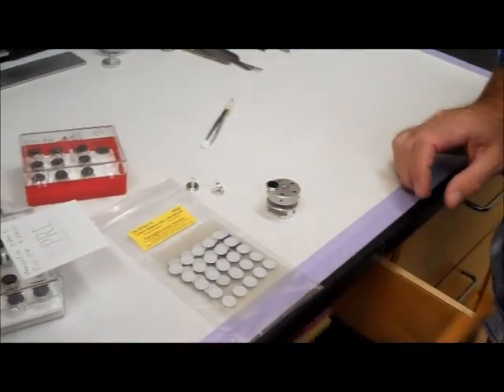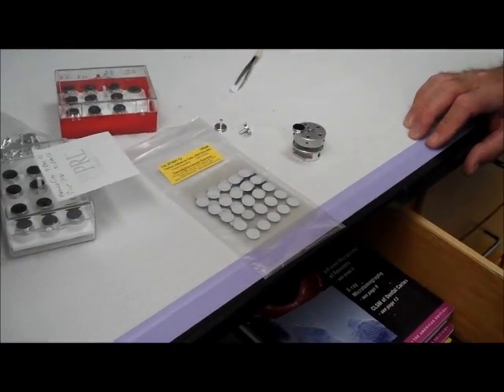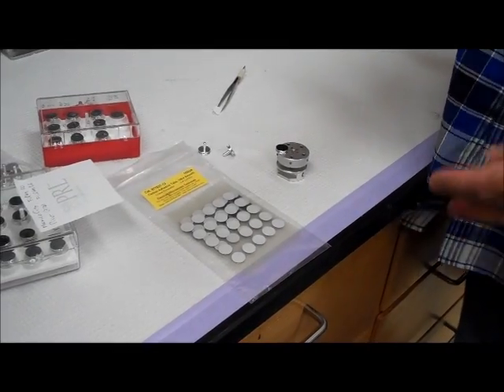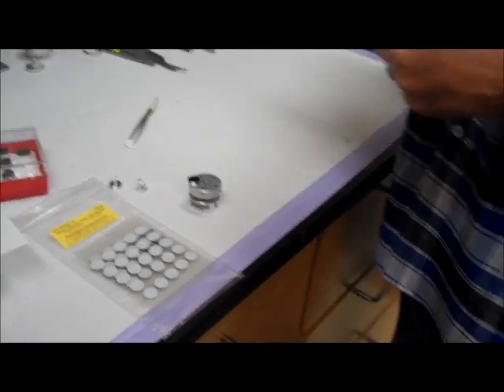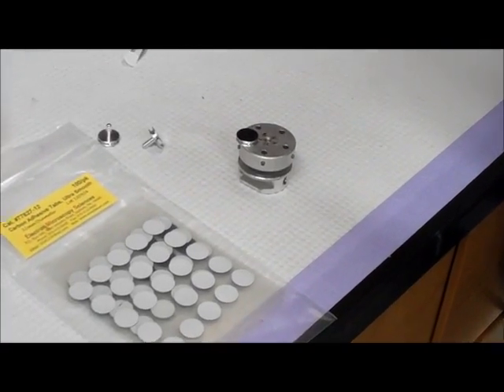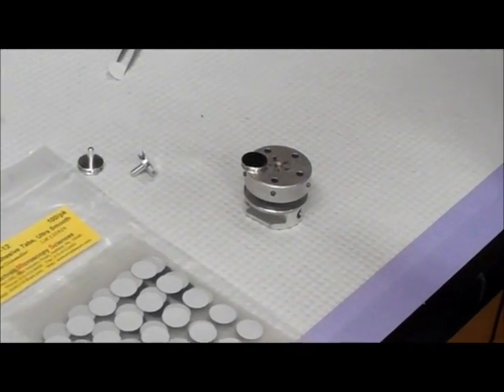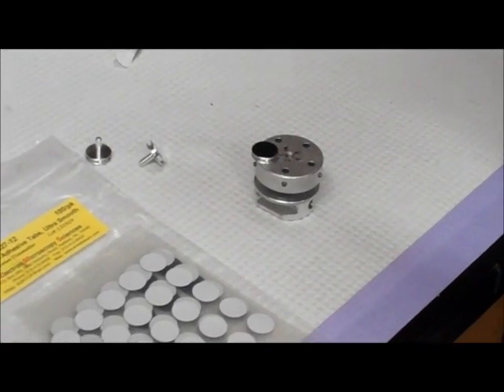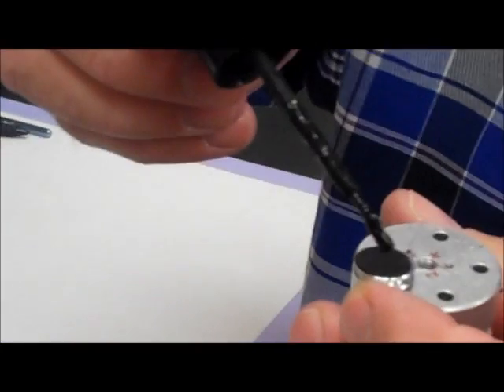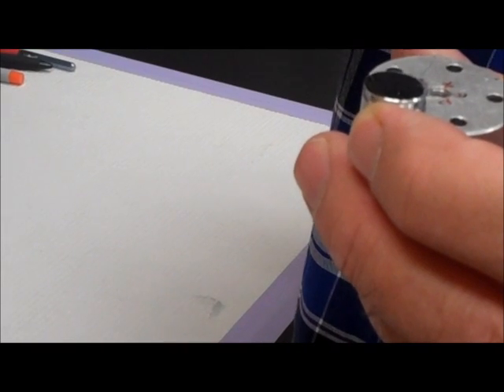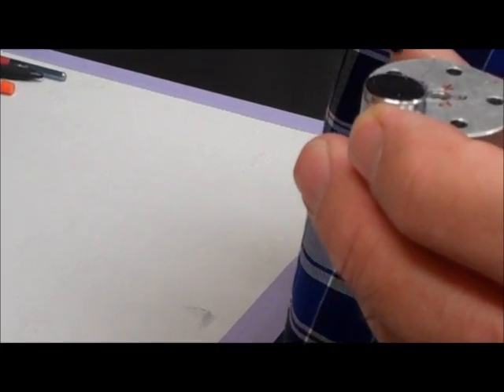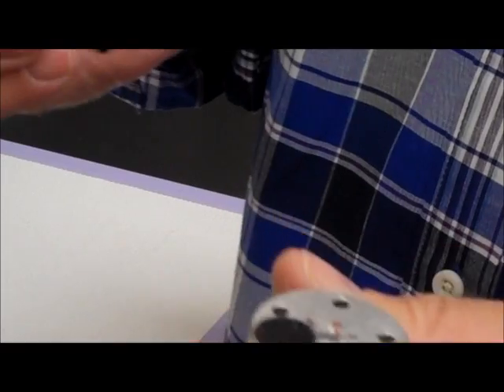And then we use some graphite paste or adhesive, and this one's kind of not in good shape so much anymore. And then let's just imagine that we had the thing on there, then we would put a drop of adhesive on each of the three corners of the mount, of the filter, like that. And then we would dry it.